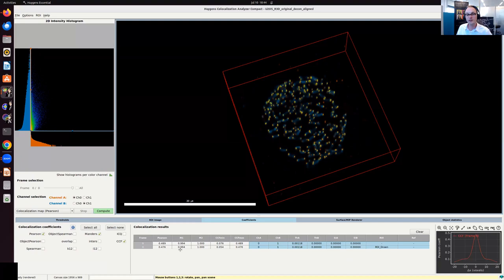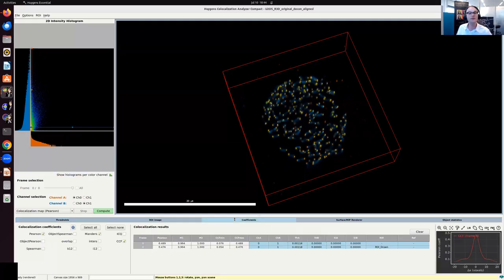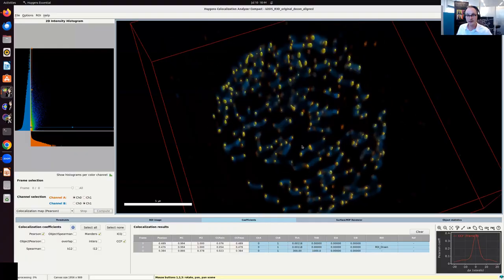Then you'll notice that the Manders coefficients are both quite high. And that's because to get the effective Manders coefficient, I need to set a threshold. So in this case, for channel A, I'm going to stick to a 5% of the maximum sort of heuristic value. And so in this case, 5% of the maximum correspond to 300 and 1,000 intensity values. And if I then hit compute again, you see that I now get the difference between M1 and M2.